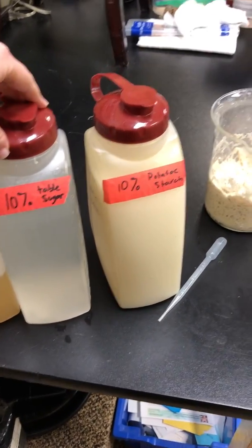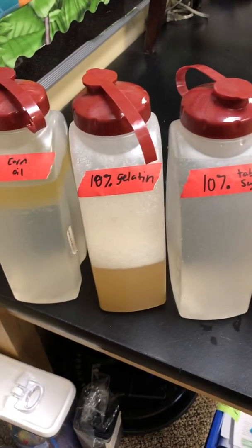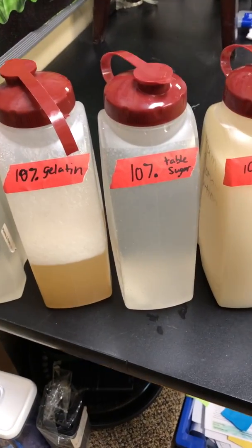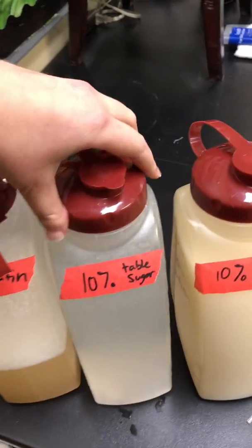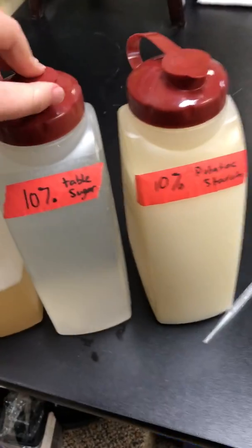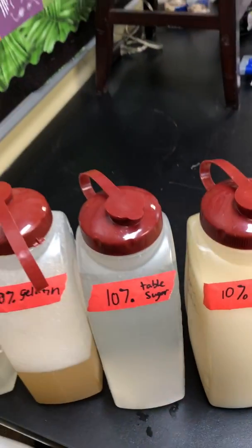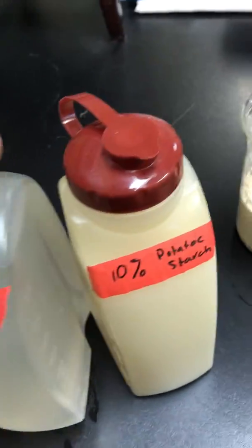So I would like to test table sugar. Guys, notice that the stuff either settles at the bottom or floats to the top depending on what type of molecule it is. So make sure Miss Deal has had a chance to shake these up before you get your sample. The tops do come off so that could be a huge mess. So make sure that only your teacher, myself, shakes them up. But we do need to shake them up.